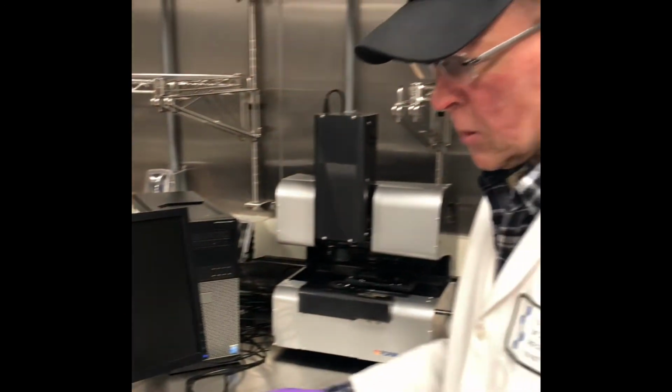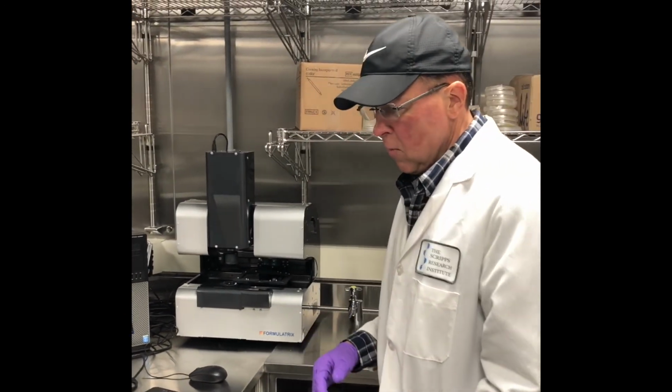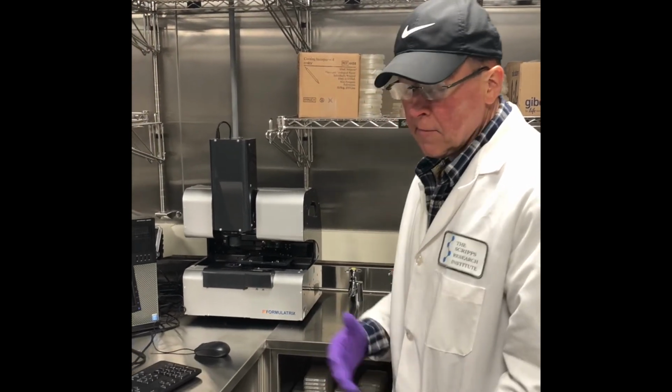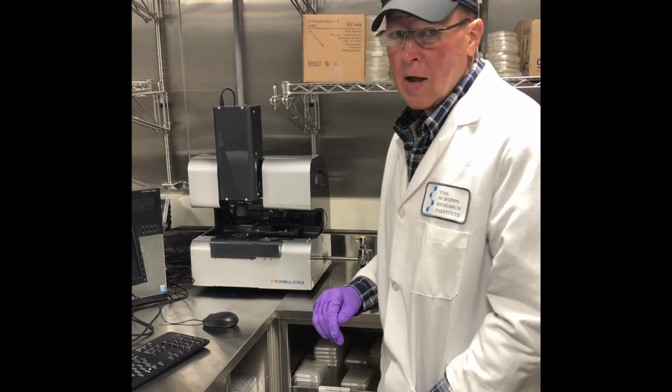Okay, that's about it. Just be sure to clean up any material that you brought with you in the experiments, store them neatly. And again, this is a physiology cold room, so there are other people's experiments in here that aren't part of the X-ray.